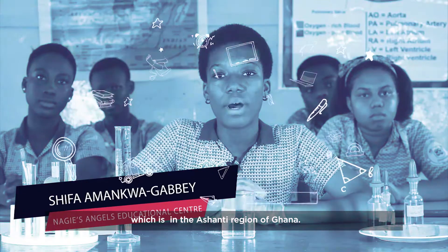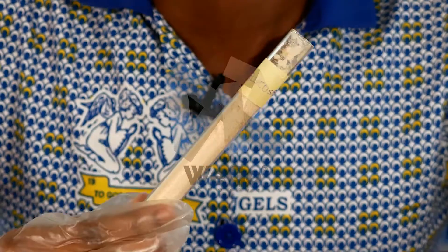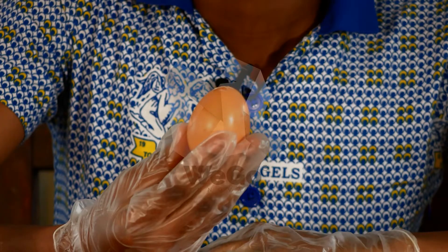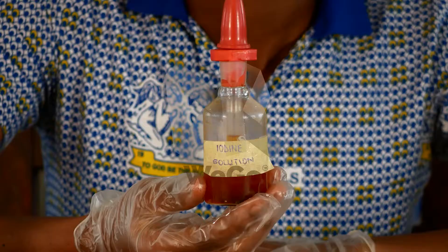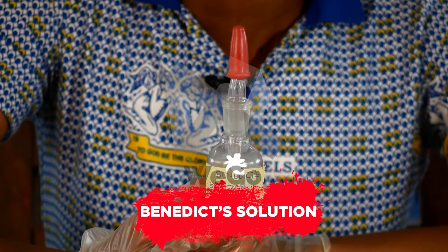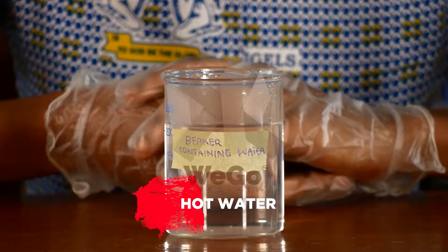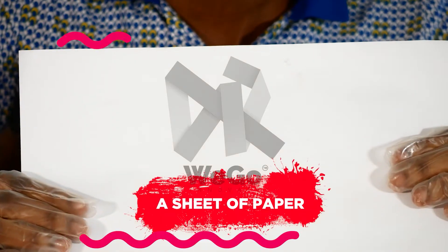For her experiment, Shifa needs a test tube containing oil, a test tube containing glucose, an egg, a slice of bread, iodine solution, Benedict solution, Millon's Reagent, hot water, and a sheet of paper.